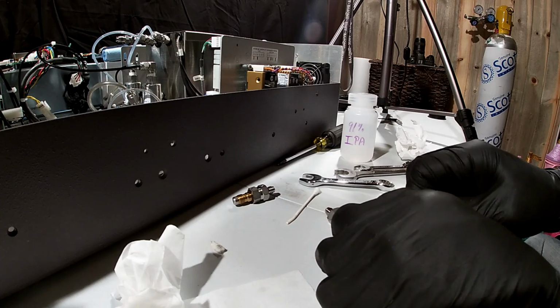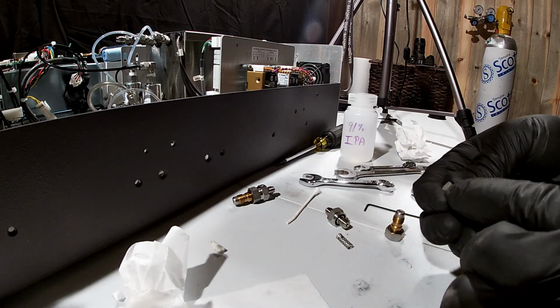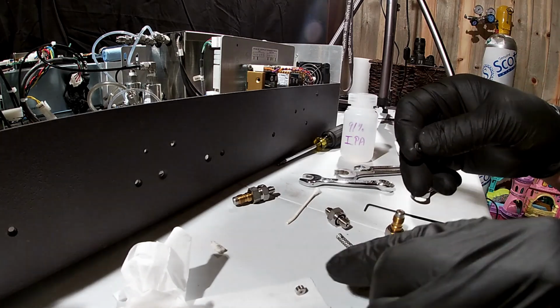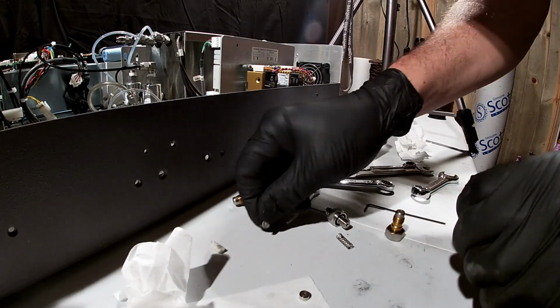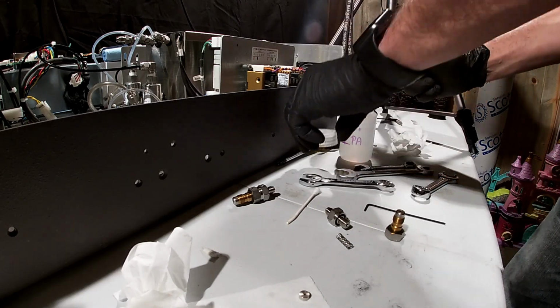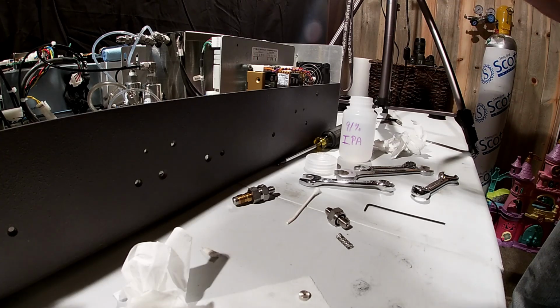So what you're going to get out of here is a little stack of pieces. There's going to be our fritted filter here, an O-ring, and then our capillary. I'm going to put the link to these. These are consumable parts. I would recommend just throwing these away. I'll set that one right to the side. I'm going to grab a fresh Q-tip and try to get down in here and clean these parts out as much as possible. That's very dirty in there. A blackish, powdery substance.